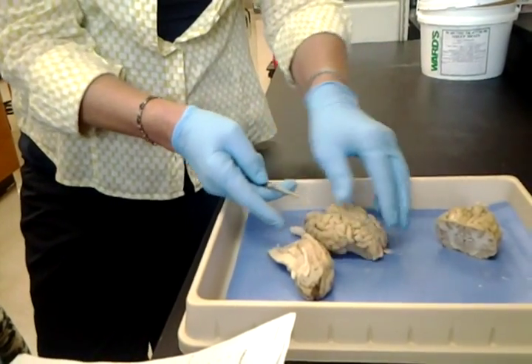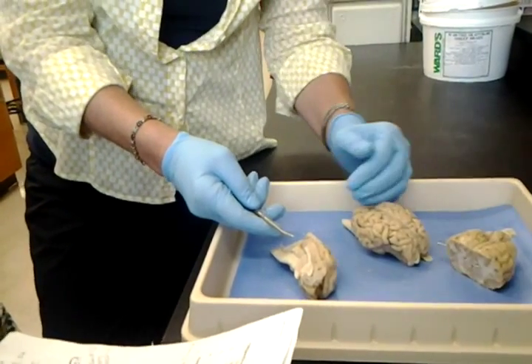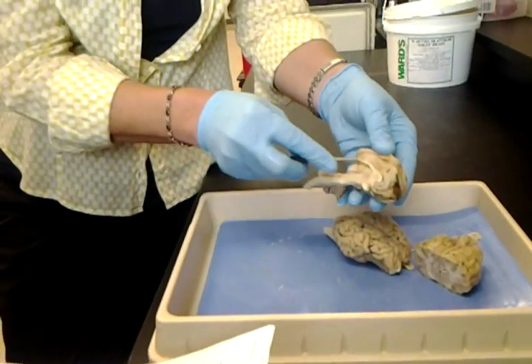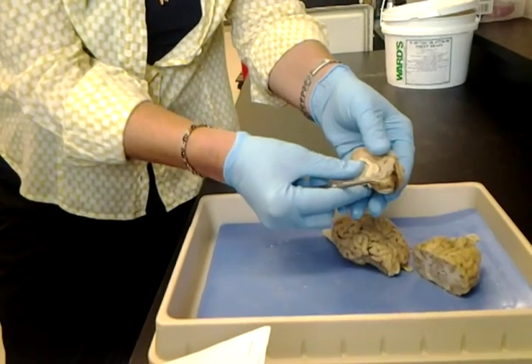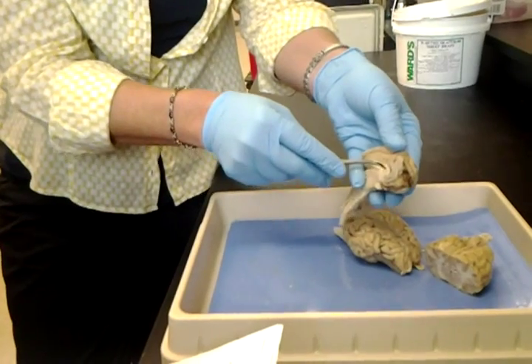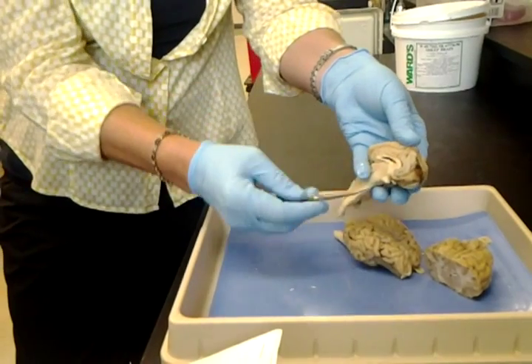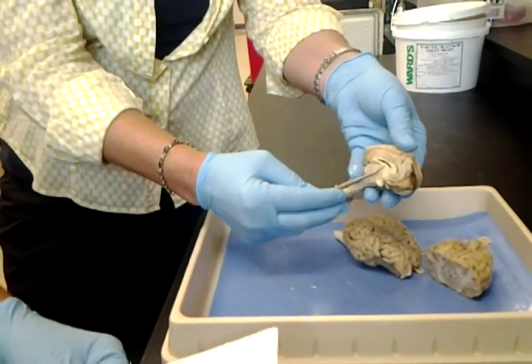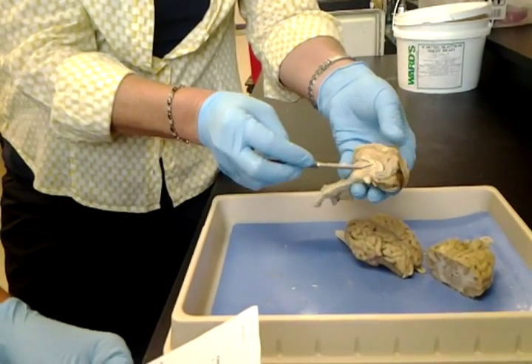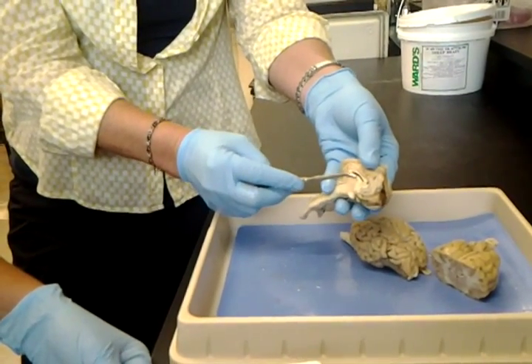Corpus callosum. White or gray matter? What do you think? White. Remember, it's larger relatively in the woman. We say the ratio is bigger. It's this one here. White matter. We'll pull it apart a little bit, and you can see that there's a ventricle there. That's a lateral ventricle. The top white matter structure is corpus callosum. The one underneath, fornix. So they're a pair. And they're clearly white compared to this gray matter here. Corpus callosum, fornix underneath it.